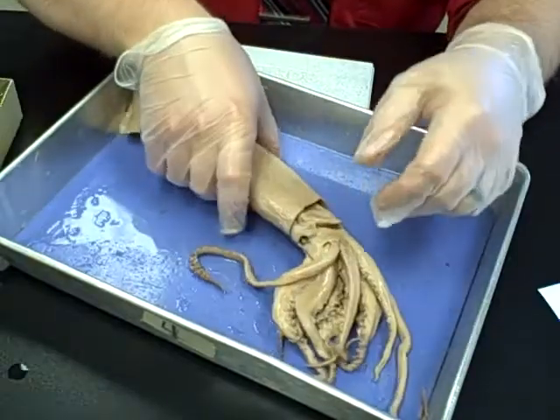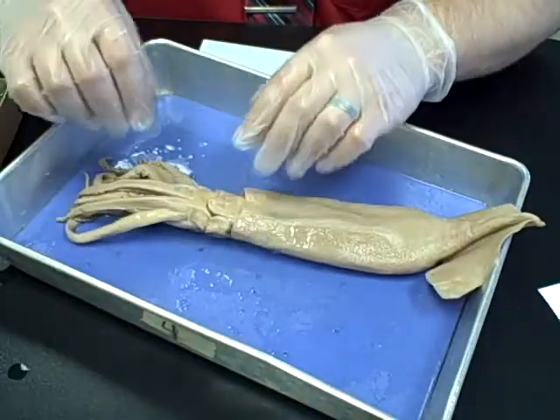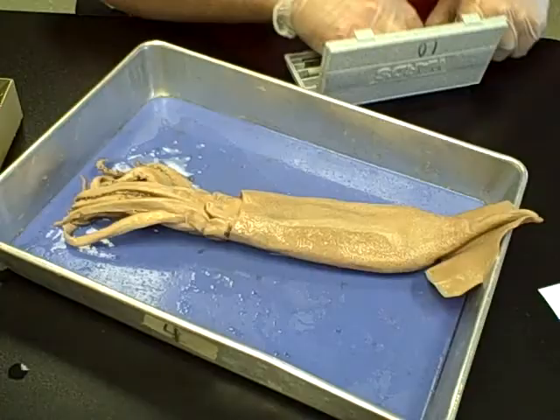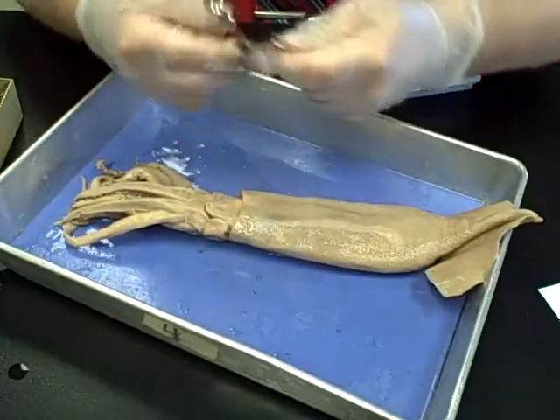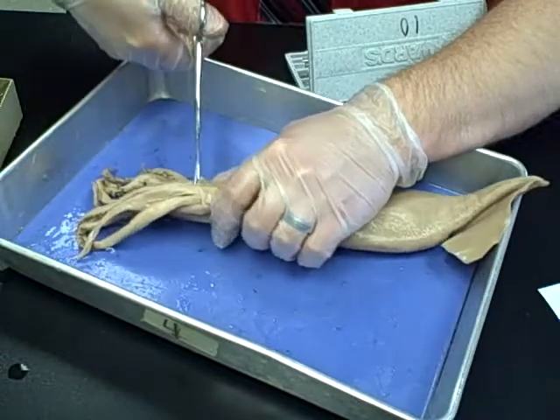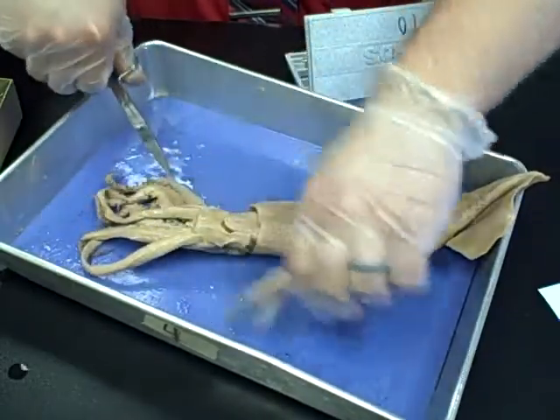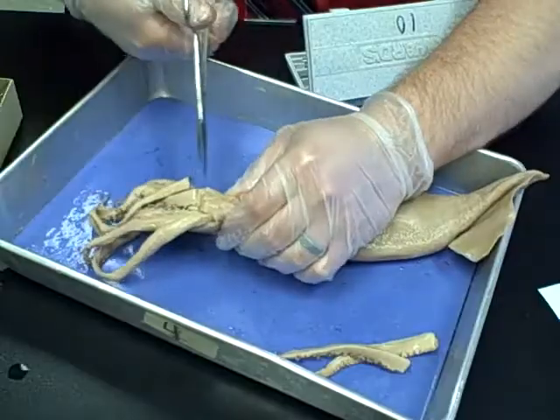The first step you have to perform is the removal of all of their appendages, which will allow us to get into the mouth more easily. One of the early steps is the removal of the beak. Use your large dissecting scissors, and cut off the tentacles basically where they meet up with the rest of the head. Make sure you keep your fingers well away — these scissors are quite sharp. Remove the extra arms and tentacles and pull them off to the side once you're finished.